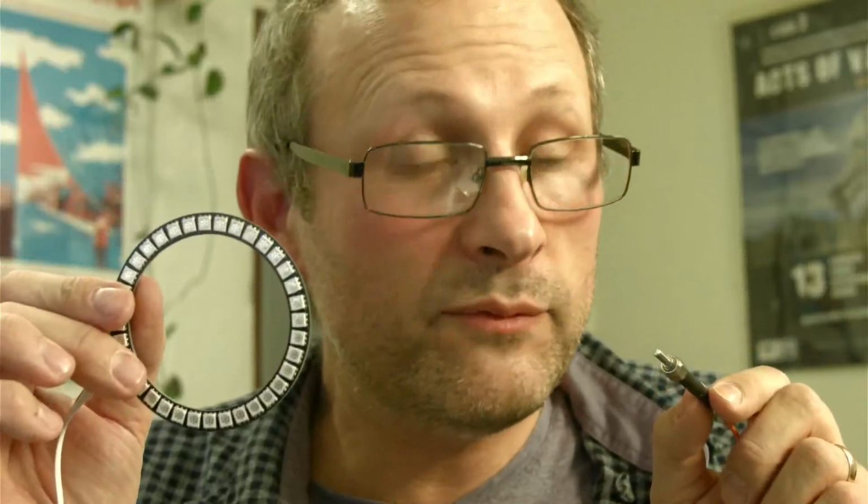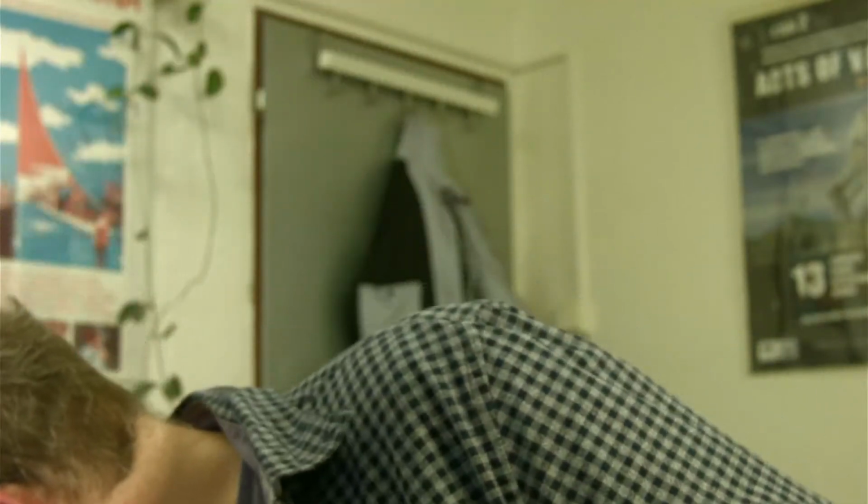Now, one thing I learnt this afternoon when I was preparing for this presentation is that these LEDs are exceptionally bright. That taught me that this will saturate, and so it may well be the case that we need to put an ND filter in front of this. I am considering, and I've thrown everything on the floor, using these wonderful sapphire windows that were provided to me by Jeff Smathers, who is an oxyhydrogen researcher in the US.